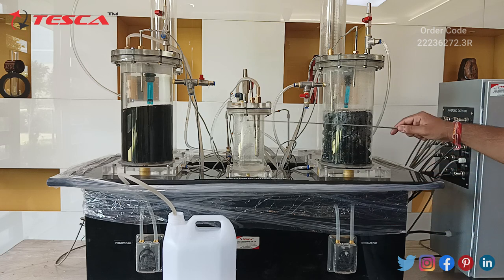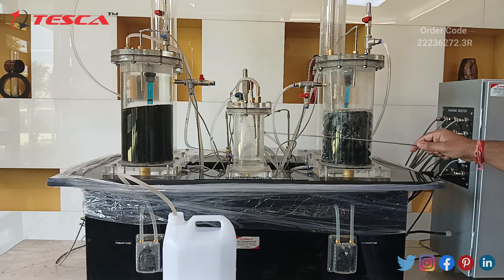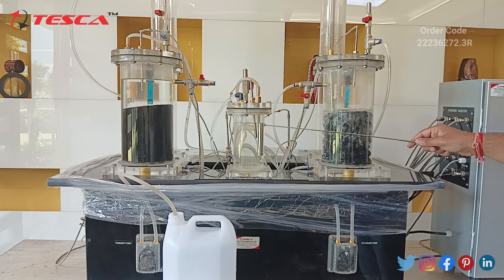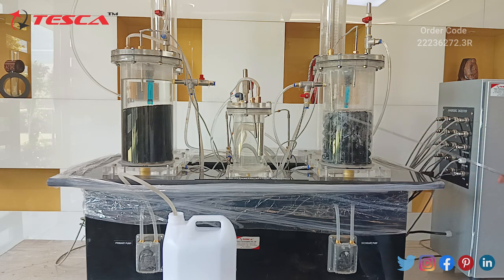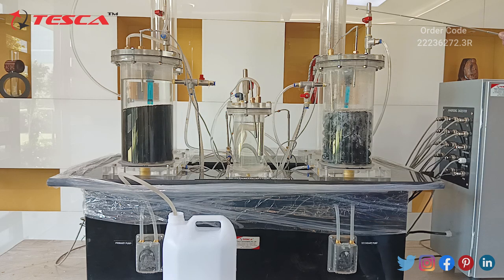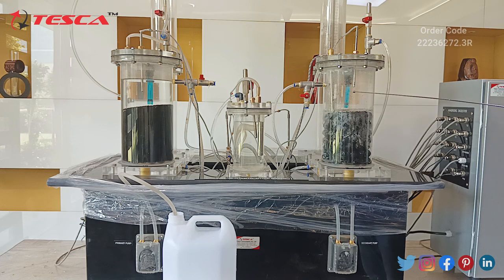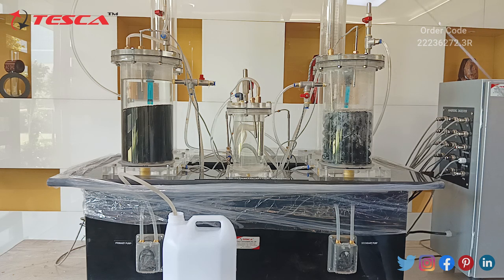Let us wait until the intermediate tank fills to a height so that it submerges this pipe. Now as we can see, the intermediate tank is filled to the required limit. Now we will start our secondary pump so that column 2 starts filling up. Before that, make sure this valve is closed so that any gas maintained in this tank will not leak out from this valve.